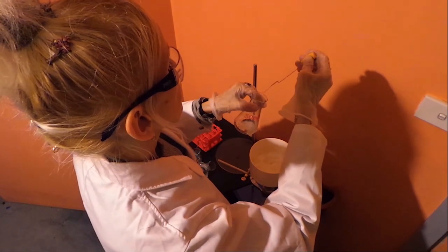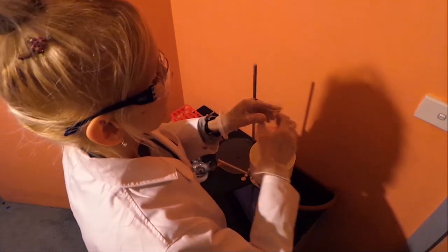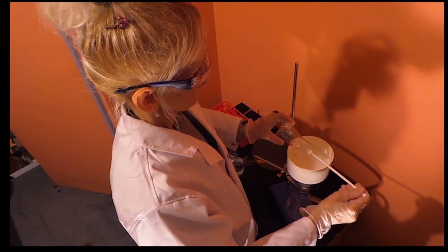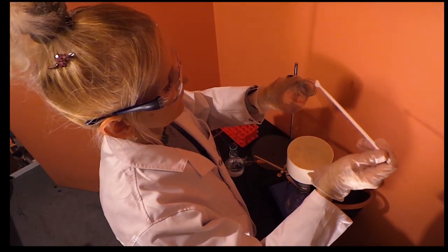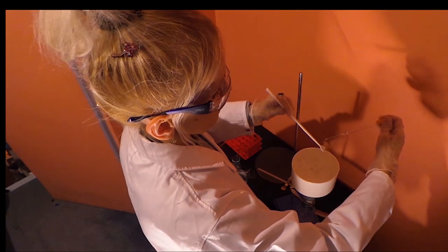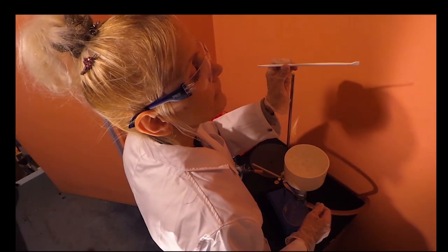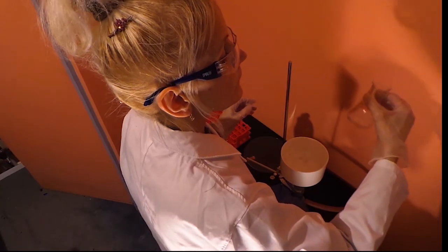To transfer the remaining solid to the funnel, rinse out the flask with the minimum amount of cold solvent and pour the rinse into the funnel. To complete the transfer, scrub the remaining traces of solid with either a policeman or a spatula from the inside of the flask, then rinse off the last traces of solid from both the policeman and the flask with cold solvent into the filtering medium.